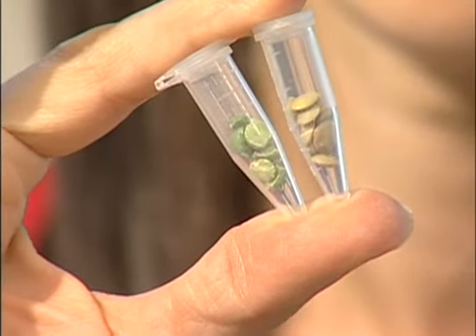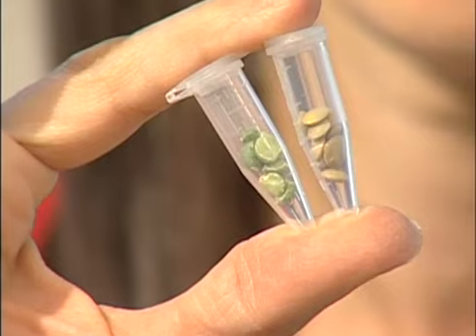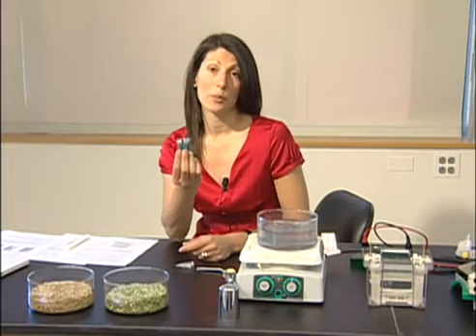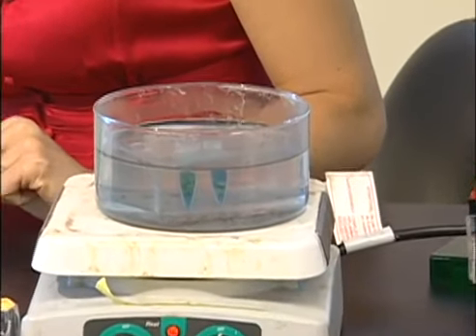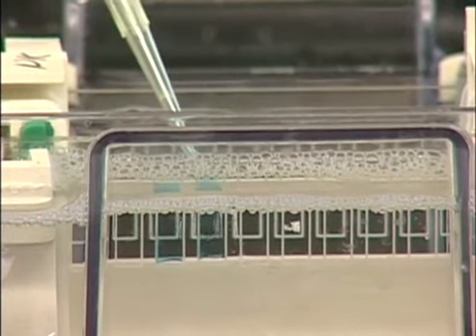That technique is called SDS-PAGE. It separates proteins based on their size, and there are three main stages to running an SDS-PAGE experiment. If we wanted to compare the proteins in lentils and green peas, we'd start by collecting cells, then add a dye with detergent that helps break the cells open. To further break the cells open, we boil the samples for a few minutes, then load the sample onto a protein gel. The gel separates proteins by size, with the smallest proteins moving fastest through the gel to the bottom using electrophoresis.